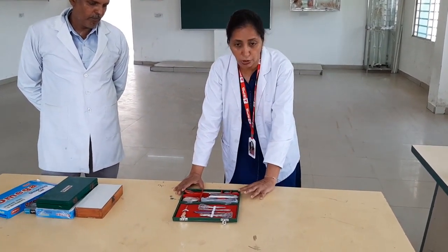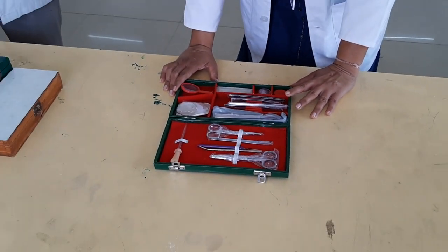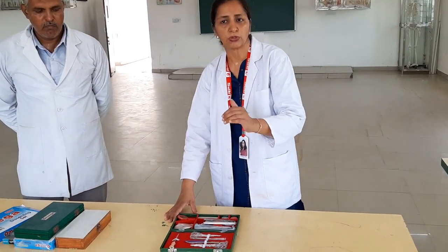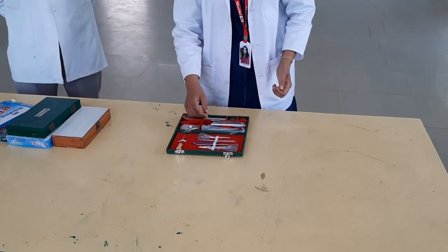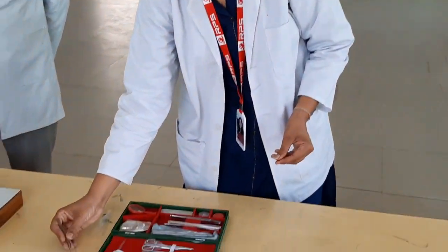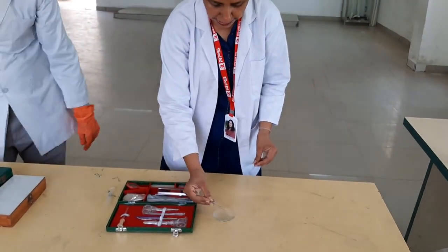This is the dissection box. Previously, every student was required to have a dissection box because we used to dissect frogs, earthworms, cockroaches, and other organisms. But nowadays, dissection of living organisms is completely banned. The first instrument is the forceps. If we have to pick any specimen placed in a watch glass, we pick it with the forceps.